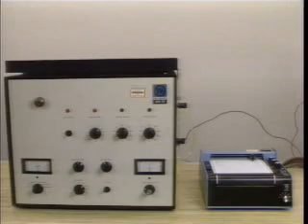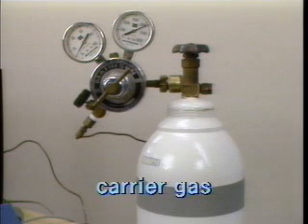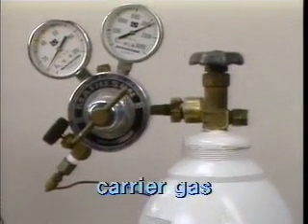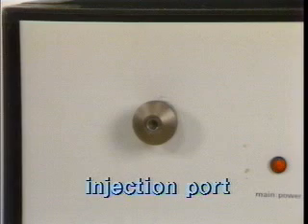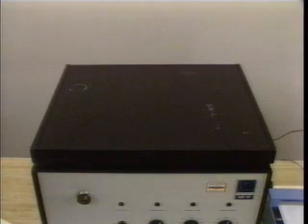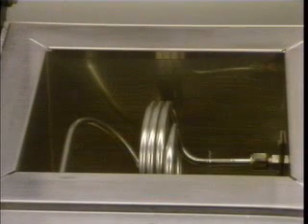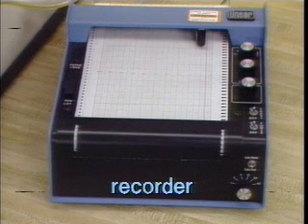Even though there are many kinds of gas chromatography instruments, there are several basic features common to all of them. The main part of the gas chromatograph is connected to the carrier gas supply. The valves required to maintain a constant flow of carrier gas through the column are located on the tank of the gas supply and on the instrument. On the main instrument, there is a port through which the sample is injected. Behind this port is a small heated chamber in which the sample is vaporized before it flows through the column. This column is contained in a separately heated oven. At the end of the column, there is a detector which is connected to a recorder.